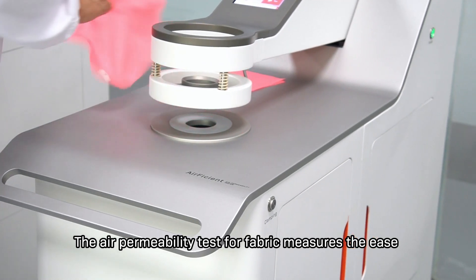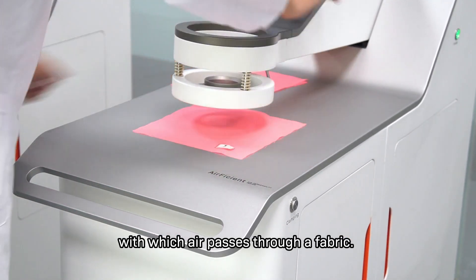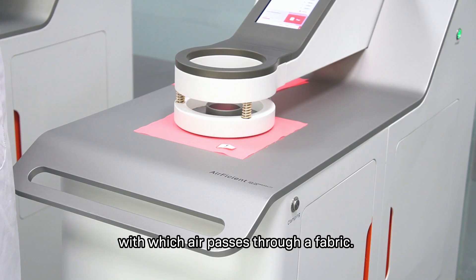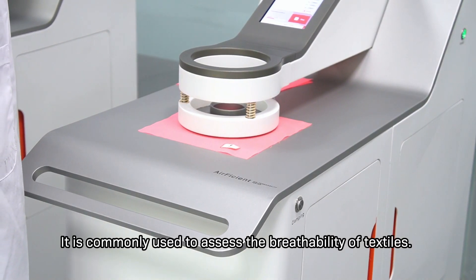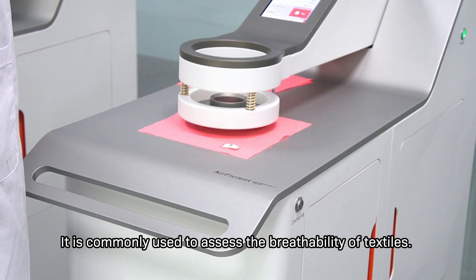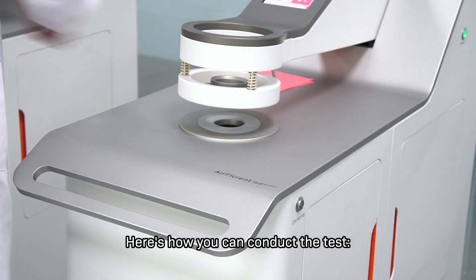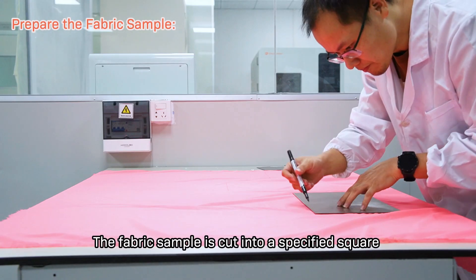The air permeability tester measures the ease with which air passes through the fabric. It is commonly used to assess the breathability of textiles. Here's how you can conduct the test: the fabric sample is prepared according to specifications.